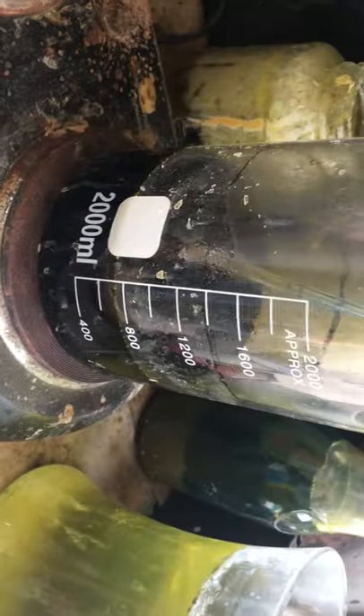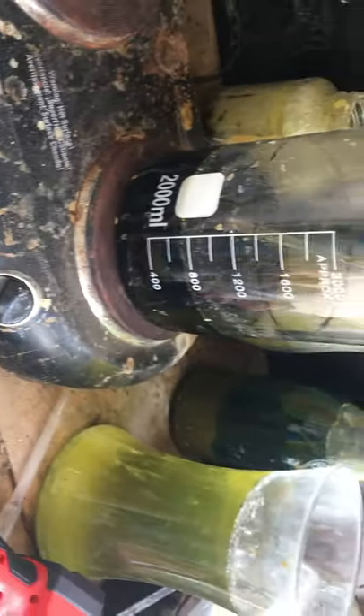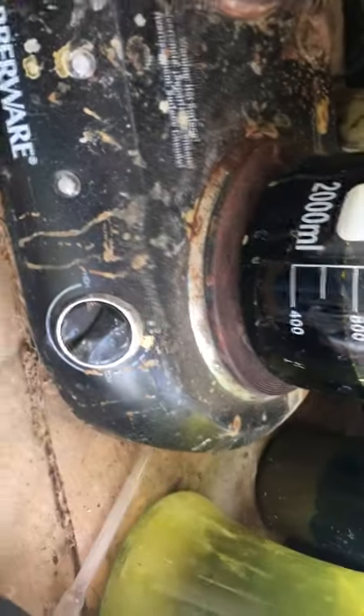Here are the guys. So this is one of the solutions I am just evaporating, to drop with zinc. This one is crazy — so I'm gonna evaporate them and see what type of metal we have or what.